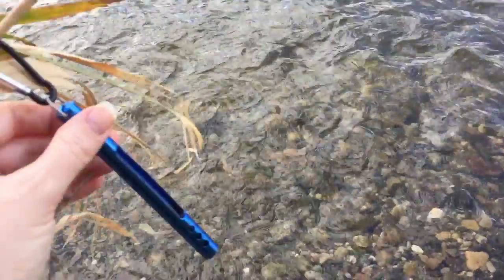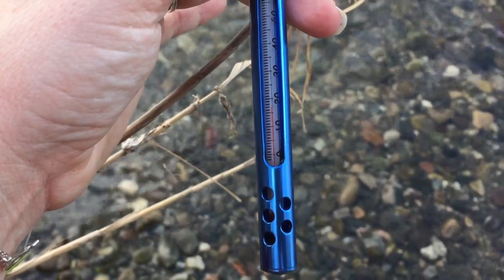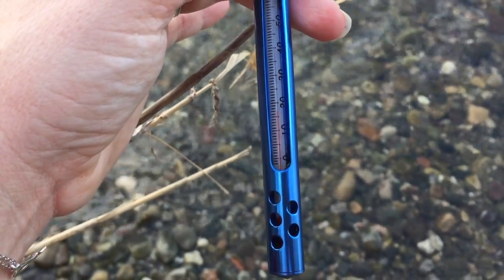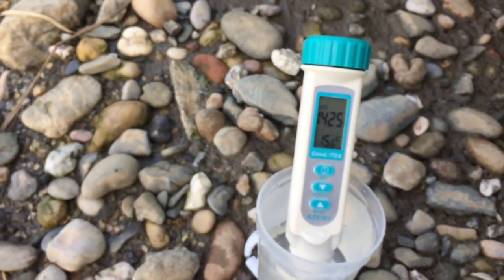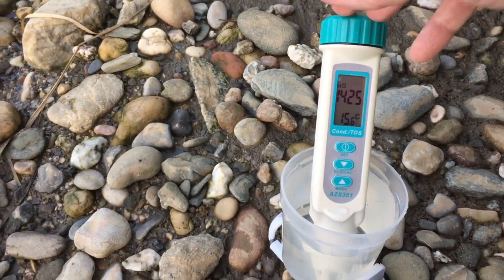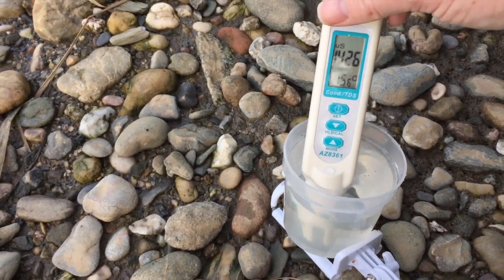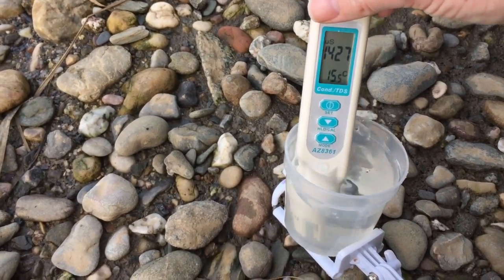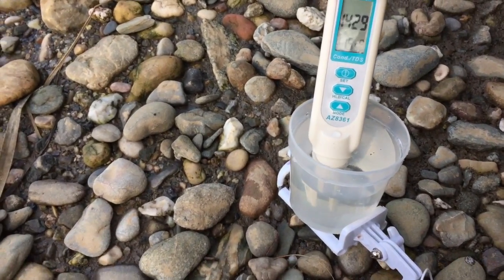And then we're going to check our thermometer. It's about 15, 16, 17 degrees in the shade here — that's our air temperature. Looks like our conductivity has stabilized. I like to swish it around to make sure you get the right reading. That looks good.